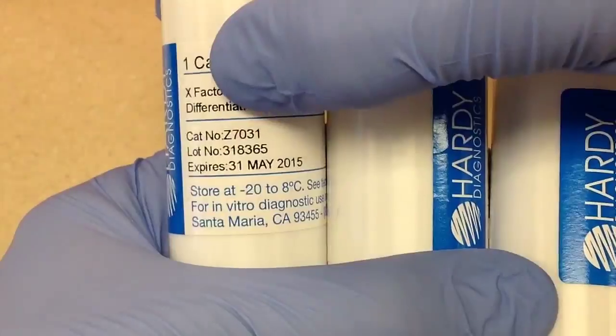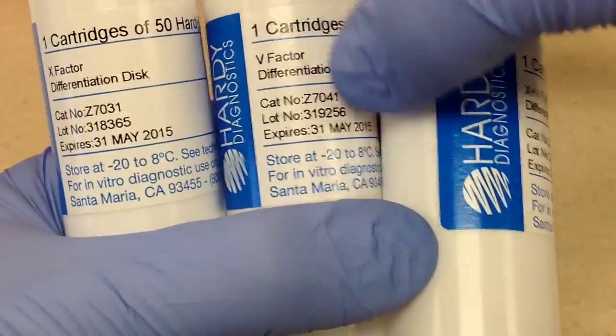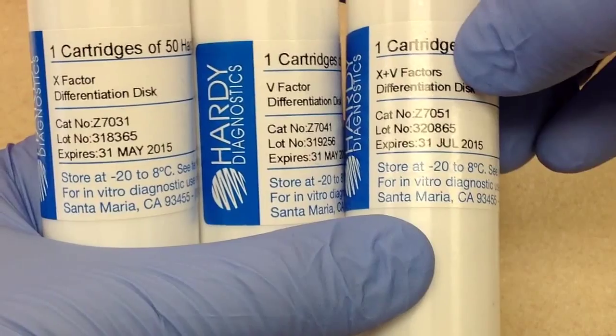And the discs are, here we have X factor, we have V factor, and we have X and V factors.